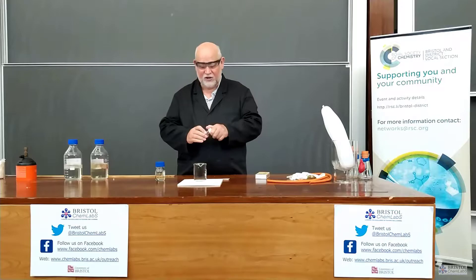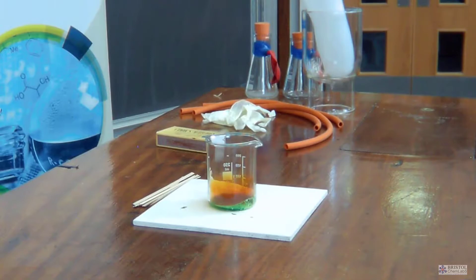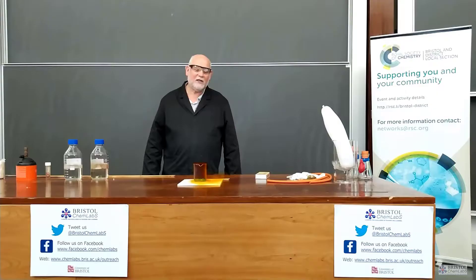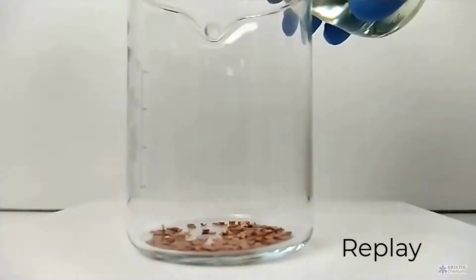In doing so, nitrogen would make nitrogen dioxide and other nitrogen oxide gases. Just so you know how we would notice that, I'm going to make some NO2 here. Nitrogen dioxide, NO2, is a particularly poisonous material. I've just got some copper there and some concentrated nitric acid. This is how we would recognise NO2 if it were in our atmosphere — this is what we would be seeing rather than a colourless mixture of gases. We'd see an awful lot of NO2, which is fairly distinctive. Let's stop that reaction by diluting the acid with some water.